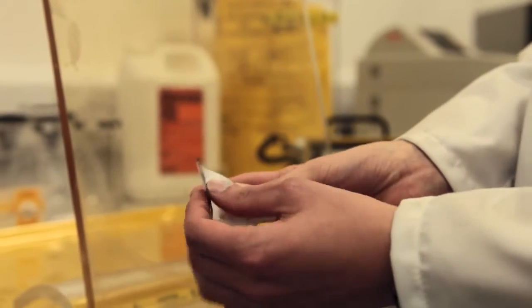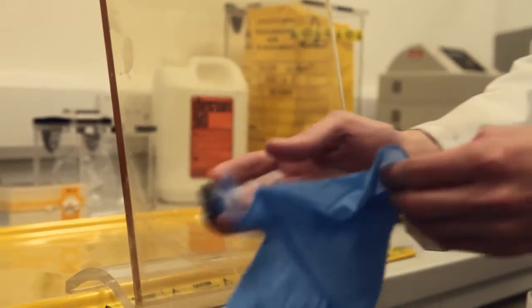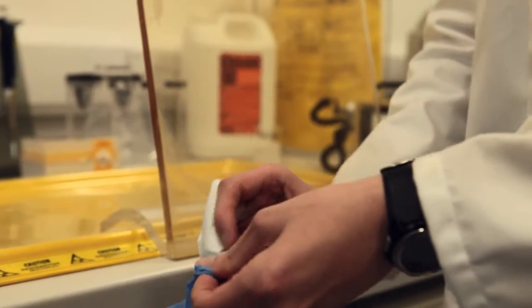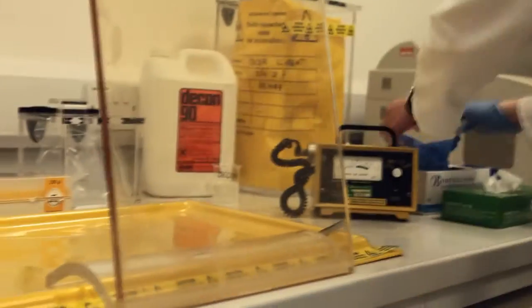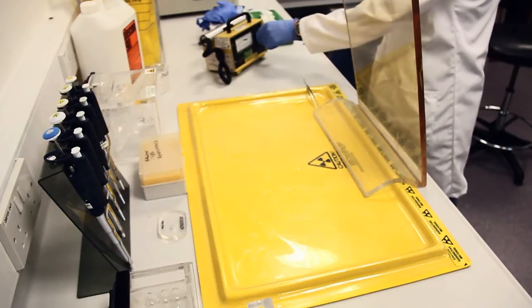David is carrying out an experiment using the gamma-emitting radioisotope iodine 125. This experiment has been run over three days and today is day two. The workstation has already been set up but David must check for contamination before he can start.